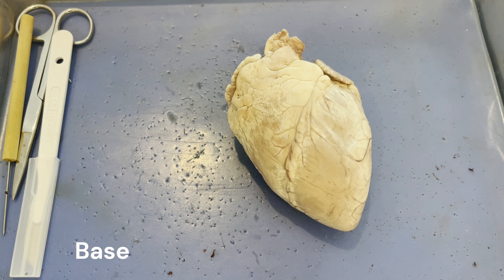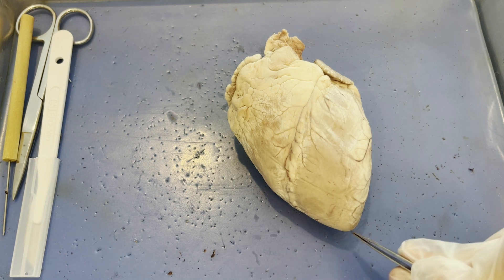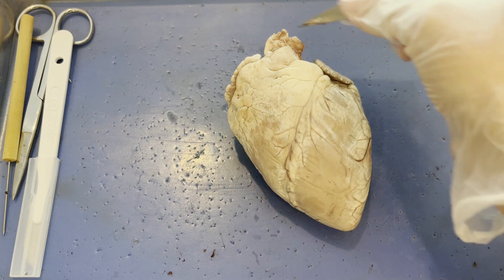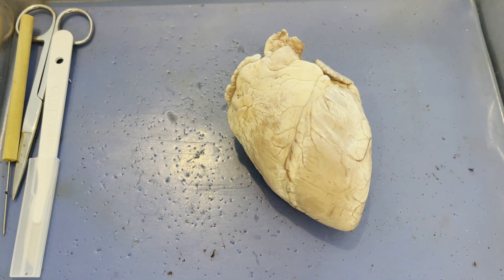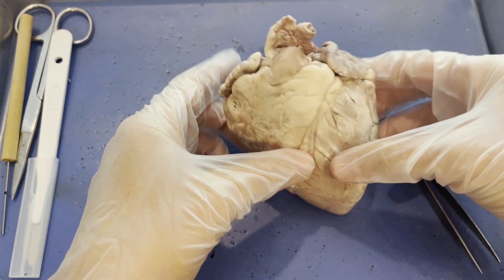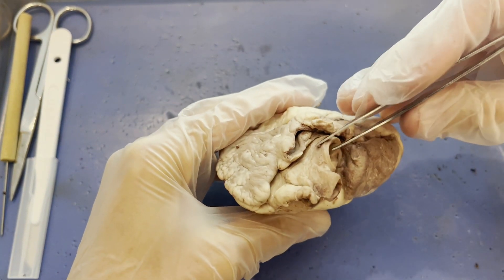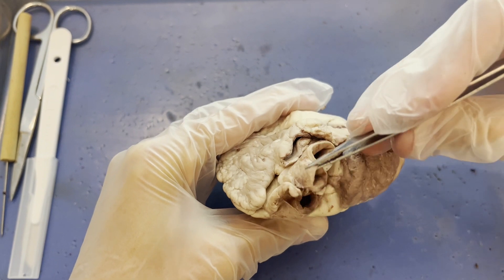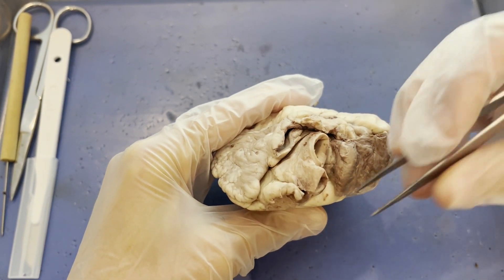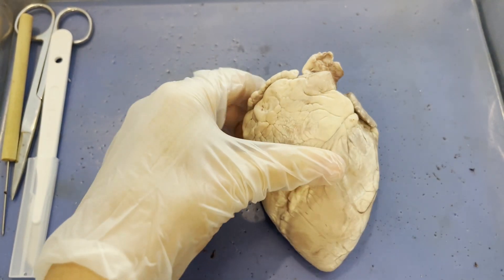Your heart is really like an upside-down mountain, with the pointed apex down at the inferior portion and the wide base at the superior portion. One thing to note about the base of the heart is that this is where we find all the major blood vessels — like the aorta, the superior vena cava, and the pulmonary arteries and veins — which we will discuss later.